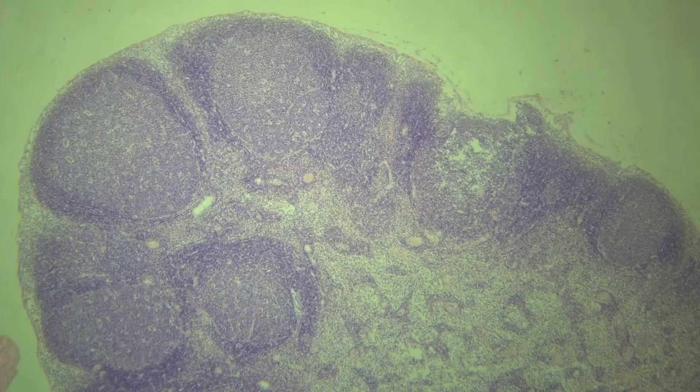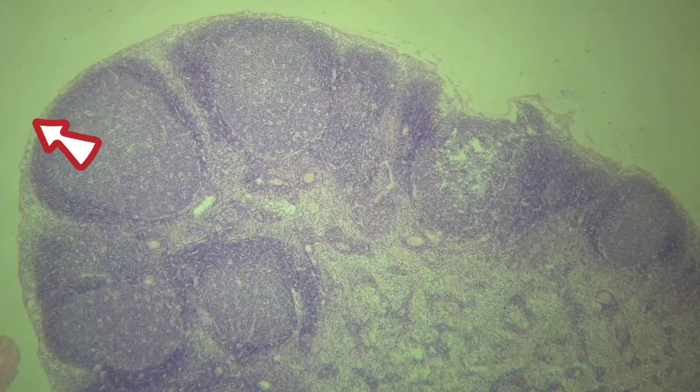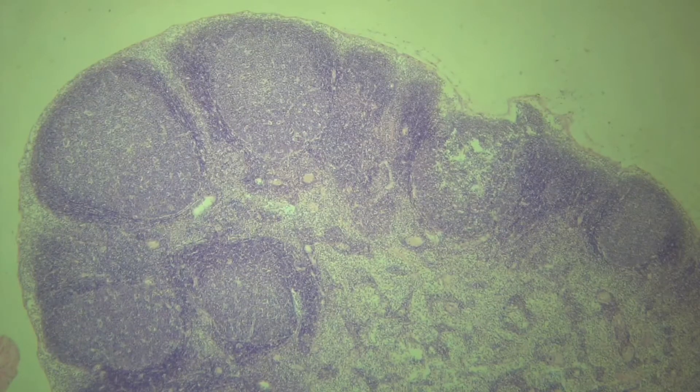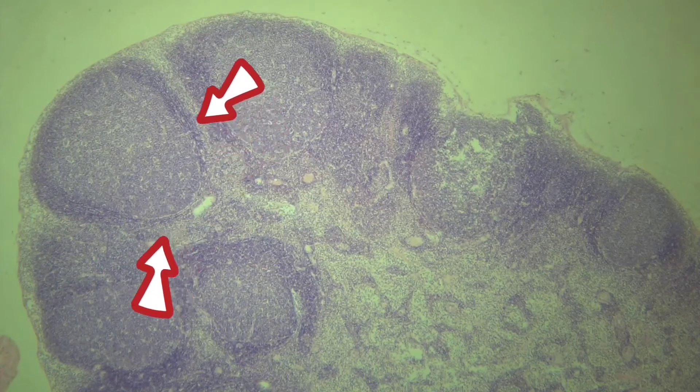Lymph nodes are covered by a thin connective tissue capsule, from which trabeculae penetrate into the organ.